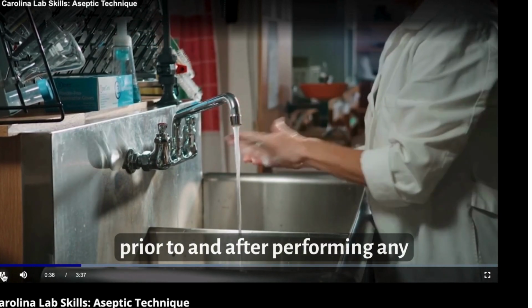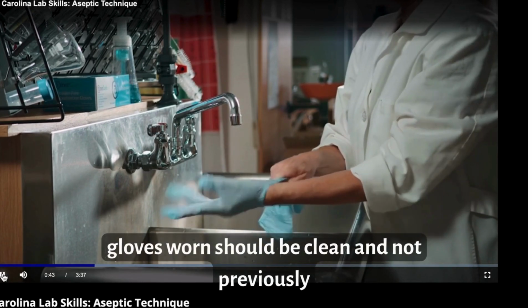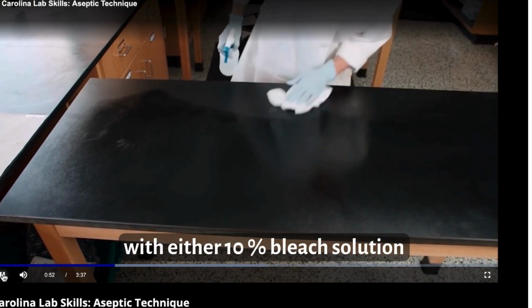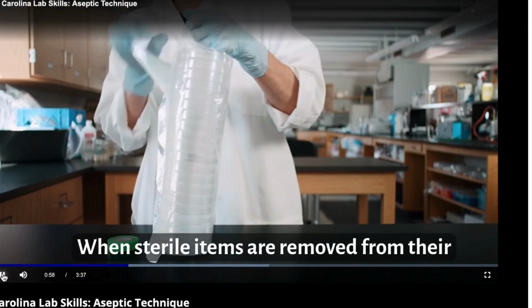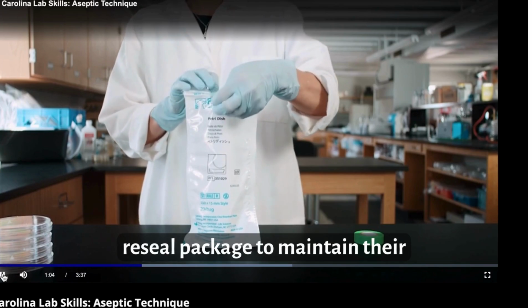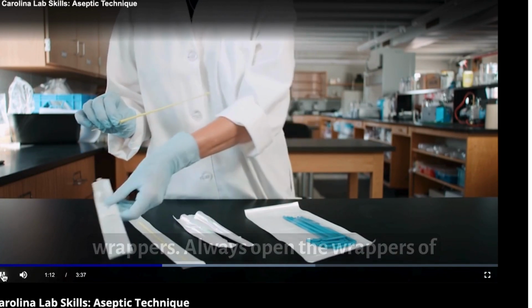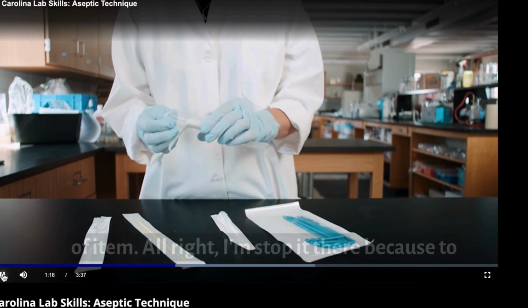Wash your hands prior to and after performing any work with microorganisms. Any gloves worn should be clean and not previously used. Before and after working, wipe down the work surface with either 10% bleach solution or 70% alcohol. When sterile items are removed from their packaging, if some items are left in the package, reseal the package to maintain their sterility. Some microbiology implements come pre-sterilized and in sealed wrappers. Always open the wrappers of sterile pipettes, loops, spreaders, or other such items from the non-working end of the item.